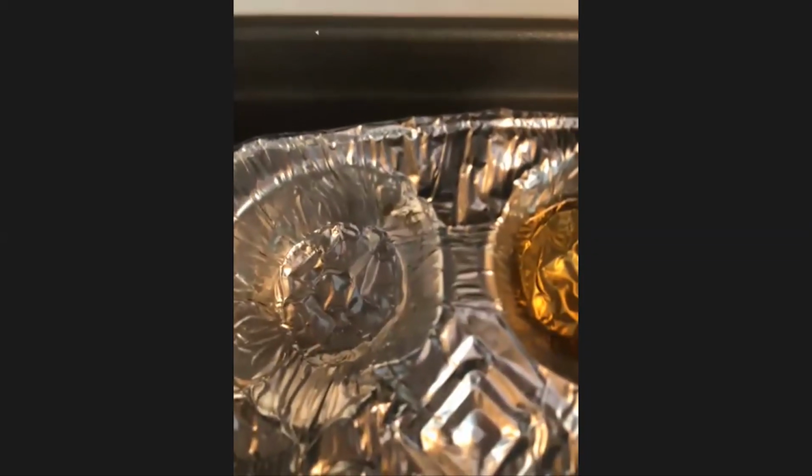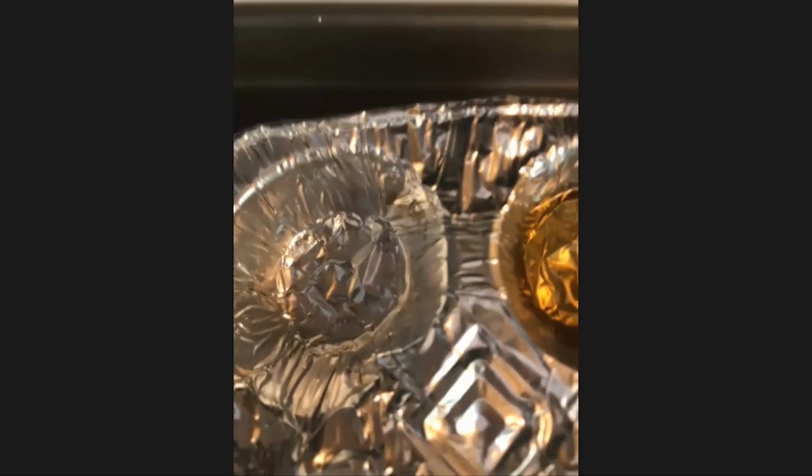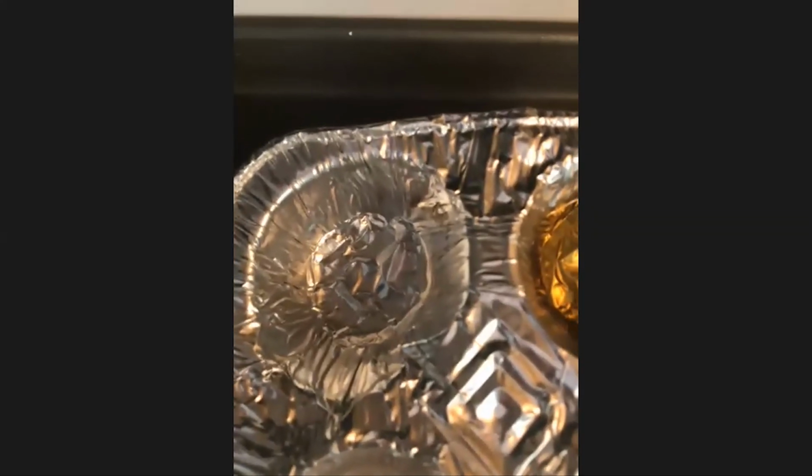Yep. If I look at the motor oil, not much happening there. Not much happening on the olive oil. Oh, but look at this. My water is definitely now going from being a solid to a liquid. Yep. And my nitrogen and my oxygen have already gone. They've already evaporated. They've already turned into a gas.